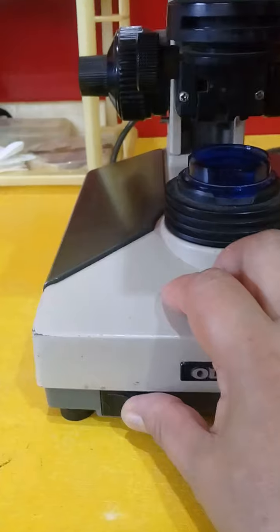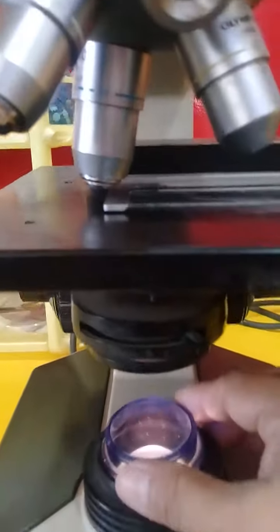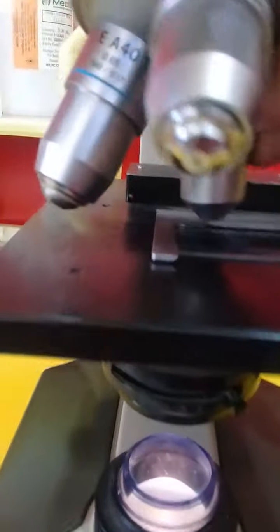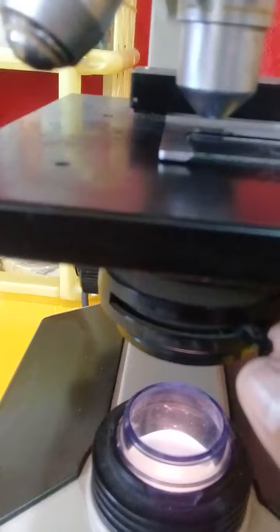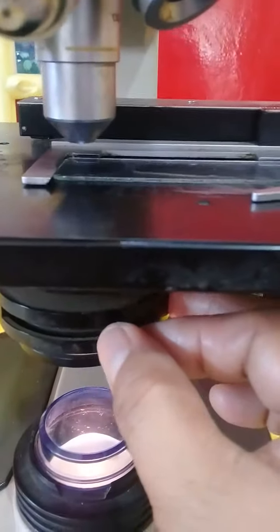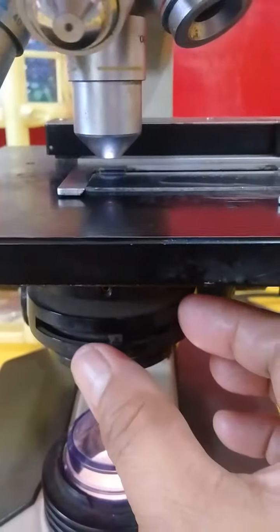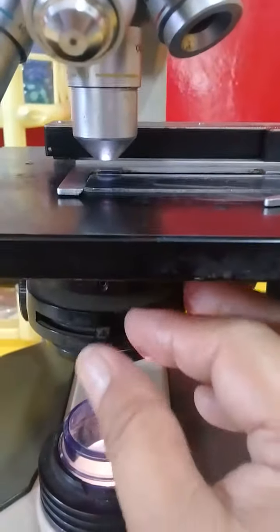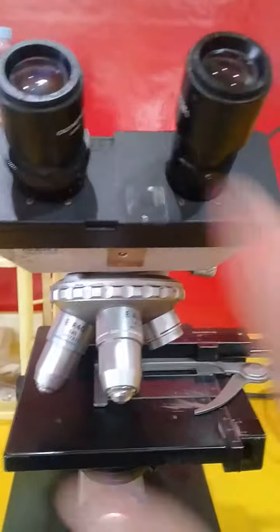You can push it on to have a light, this one. This is how the light goes through. You can adjust this one — if you turn on the light or off the light — and you can look through here.